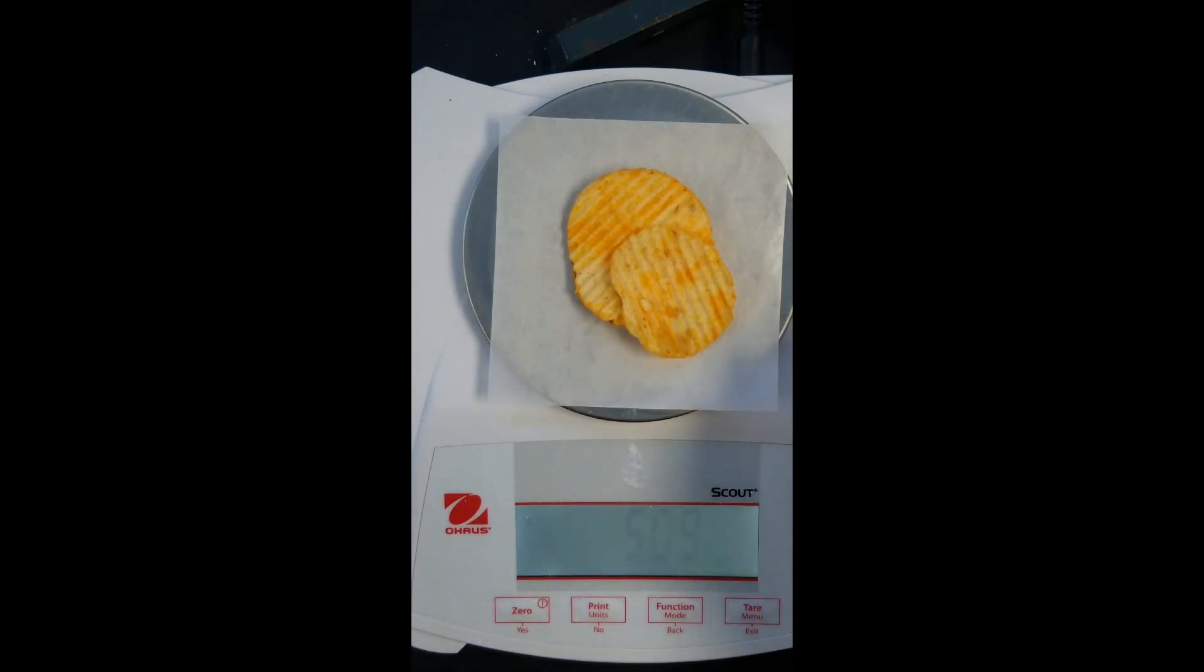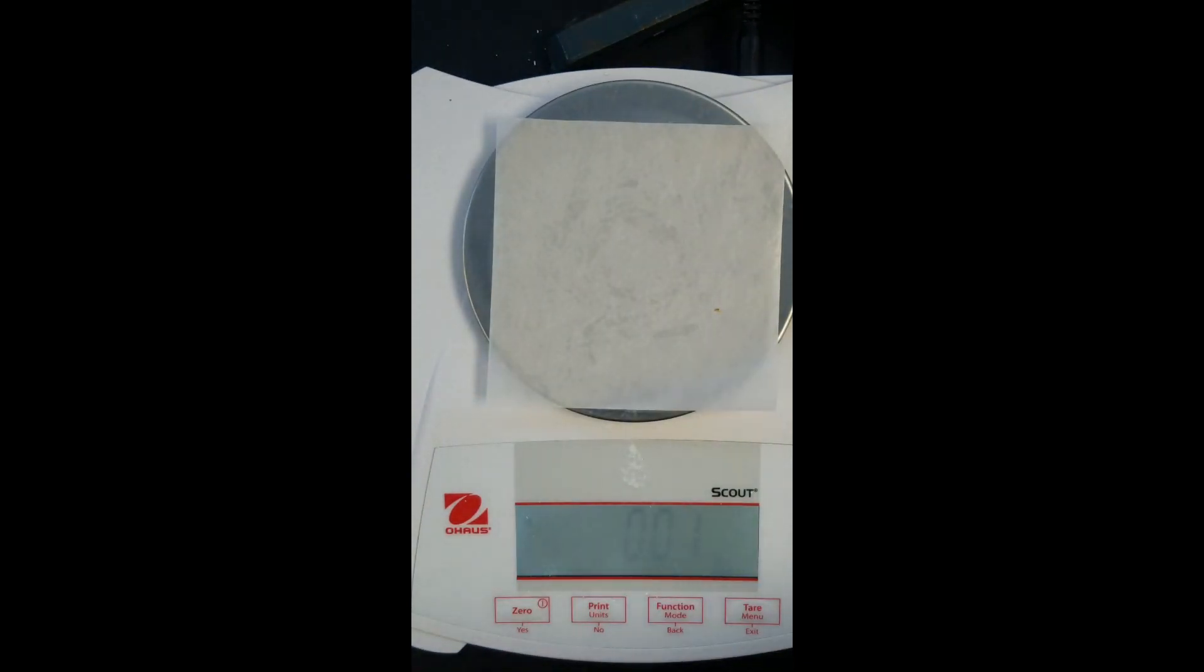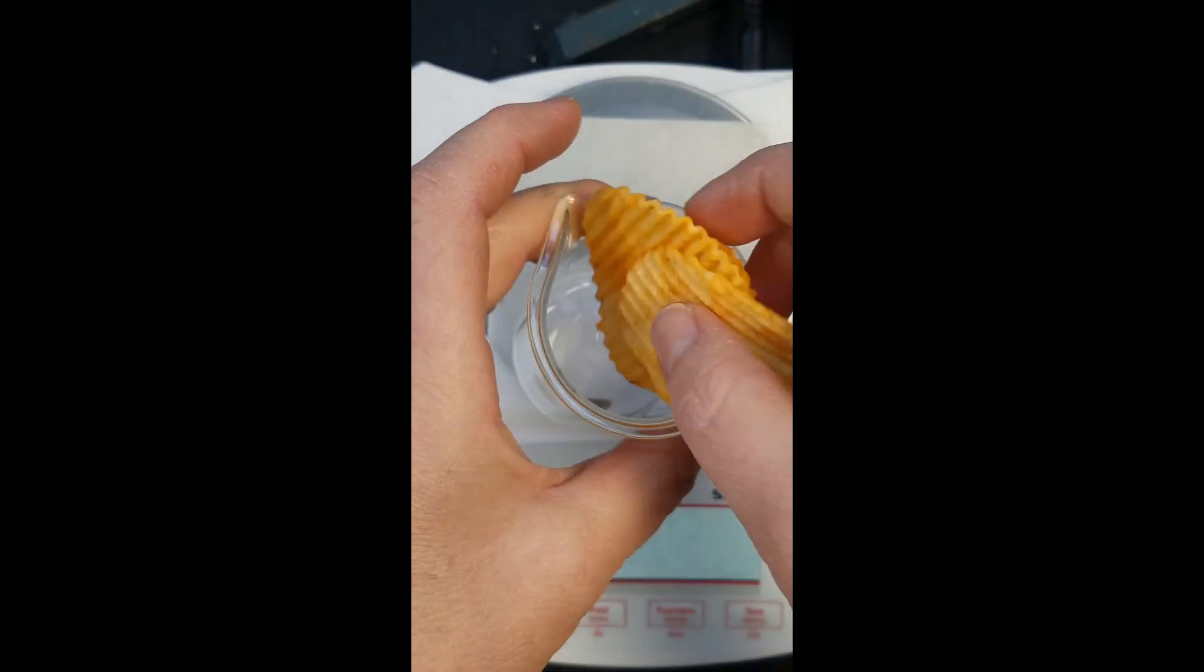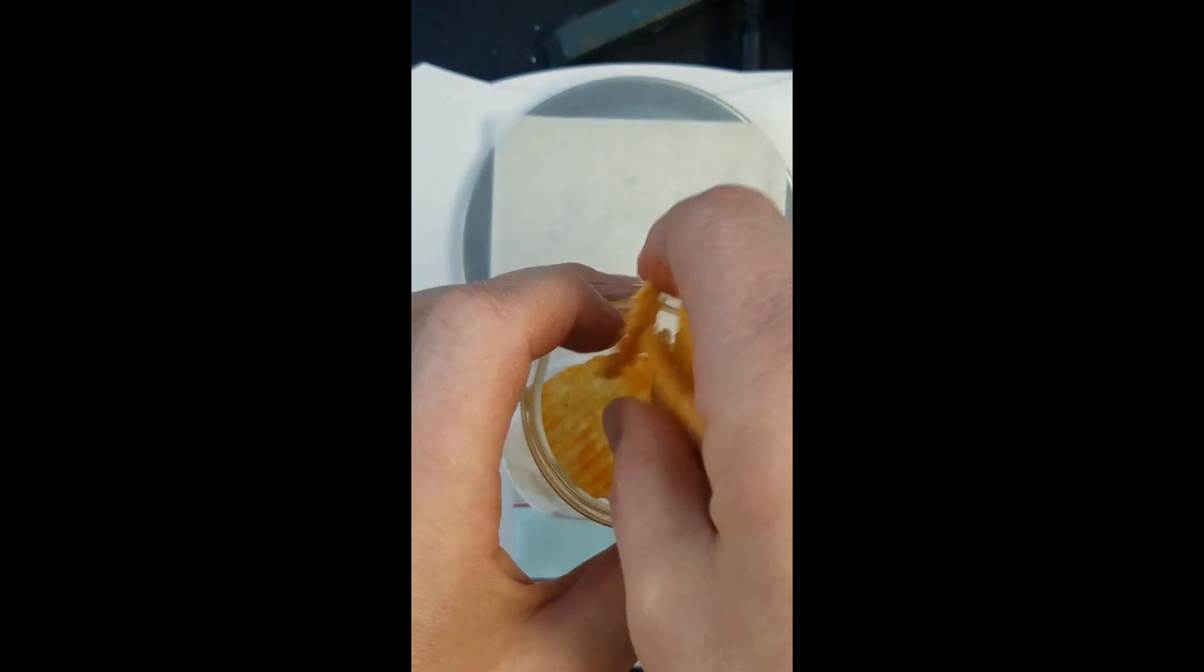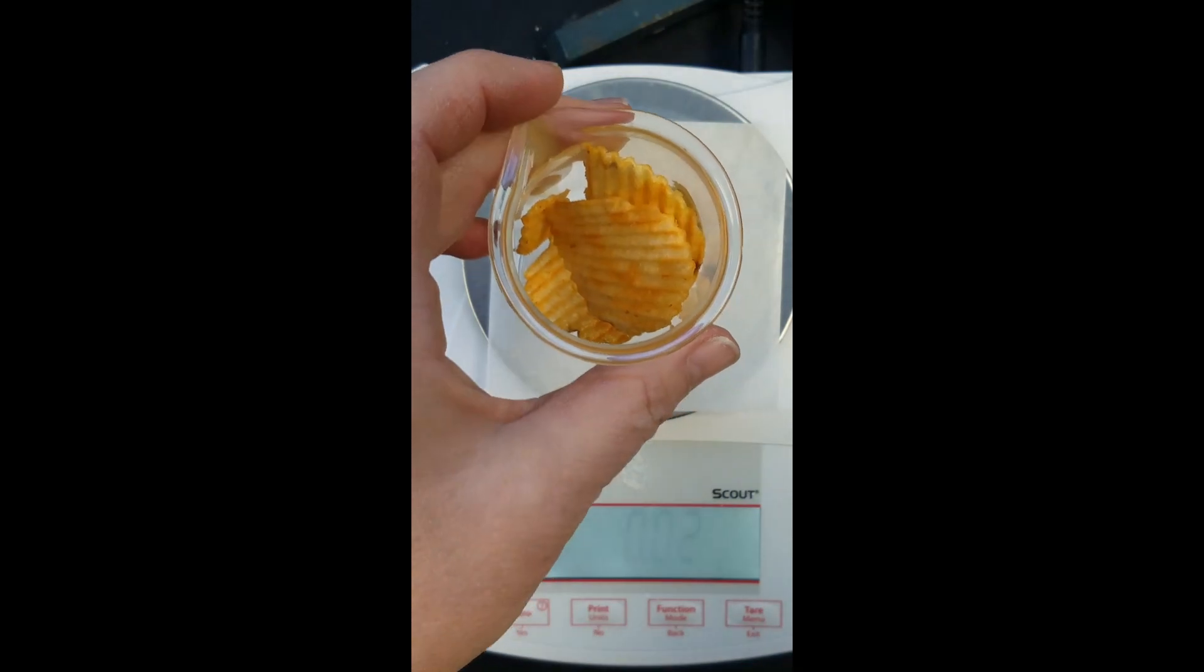And again we don't need this mass. We're going to get a mass of that more accurately and put our chips into our beaker and we'll work on crushing these up.